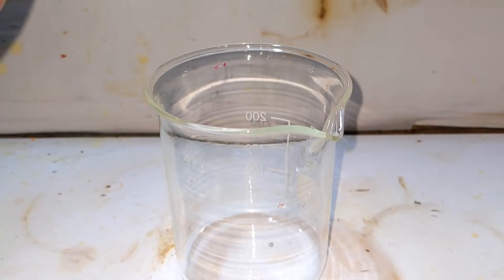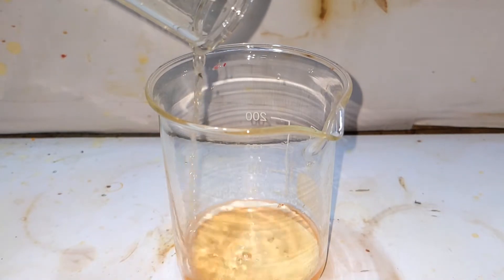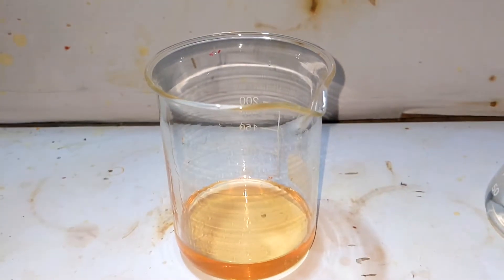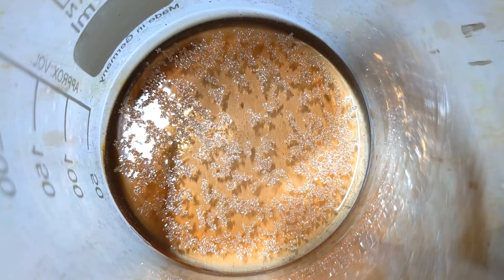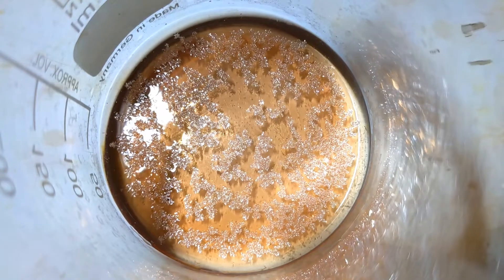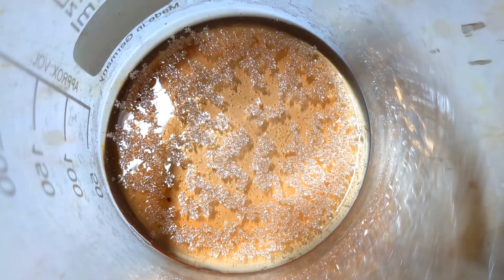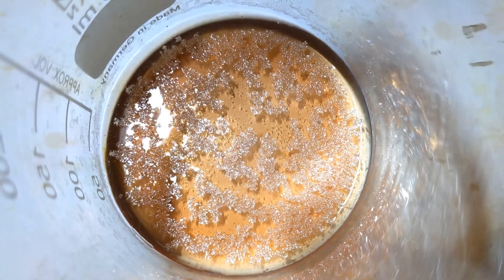The mixture was allowed to settle down and the solution was drained into another beaker. You can now evaporate the solvent to obtain the crystals. On evaporating the solvent, you can see how the crystals of thymolphthalein are forming. These are the final crystals of thymolphthalein.